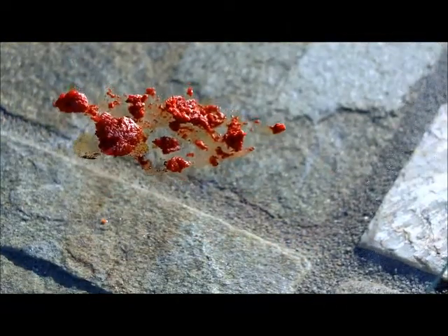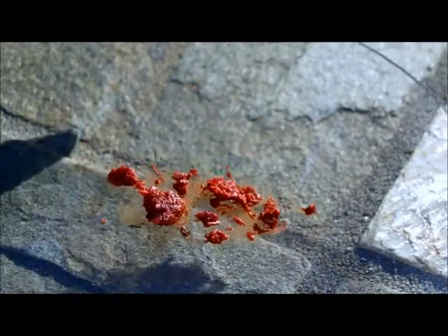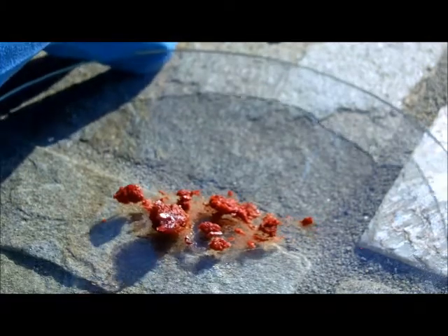To dry, break up these chunks and then desiccate it over sodium hydroxide to neutralize any remaining acid fumes. I'm just keeping this as a sample because I think it's pretty.